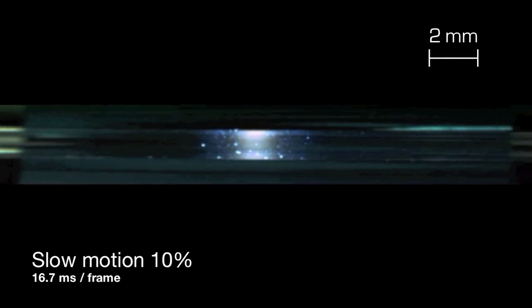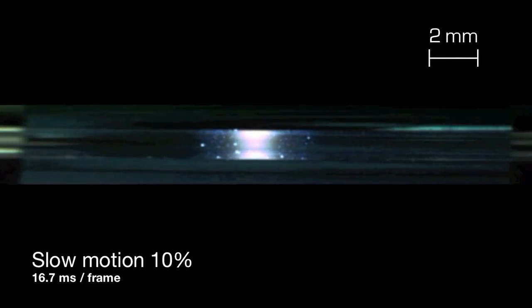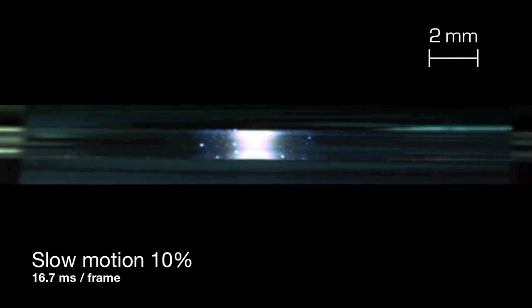In this slow motion clip, individual frames are 16.7ms apart. When the glass is glowing white, the weak pull starts drawing the halves of the capillary apart and the hourglass begins to form.